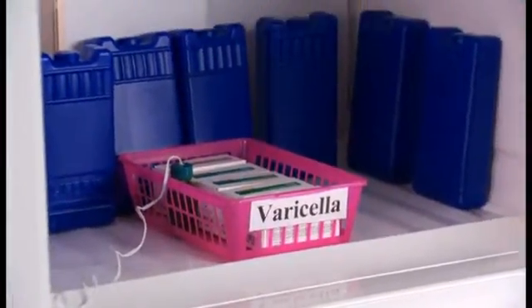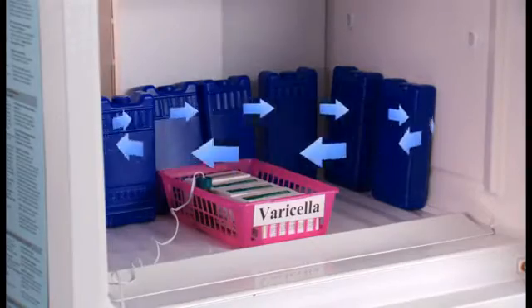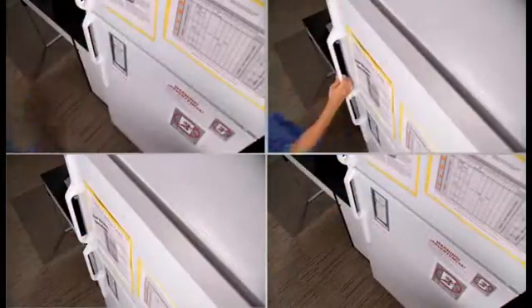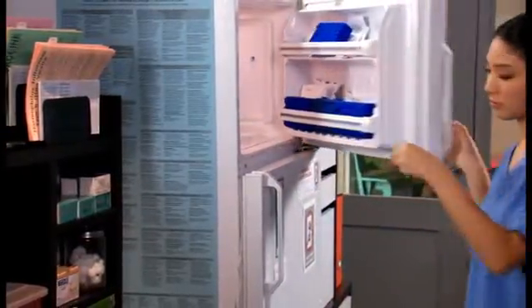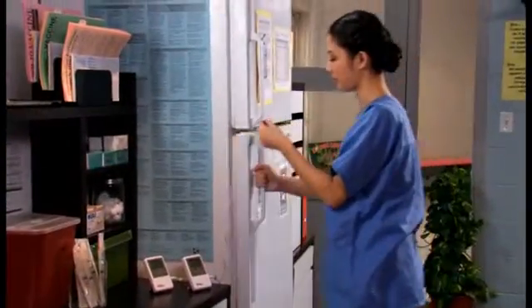Vaccine placement in the freezer should also be in the center of the freezer, away from the walls or the freezing component. It's important that you and your staff avoid frequent opening and closing of the refrigerator and freezer doors, as this can cause fluctuations in temperature. Never leave the door to the refrigerator ajar — make sure the door is closed securely each time.